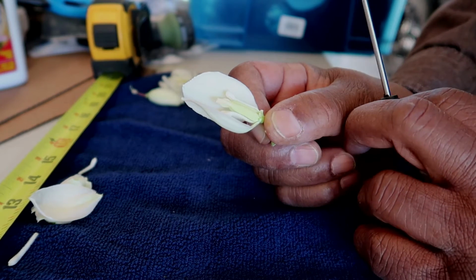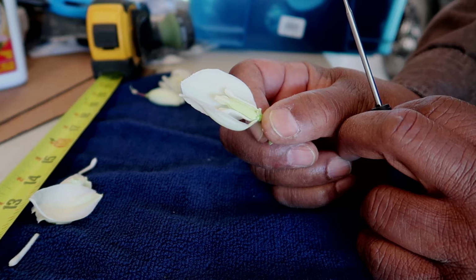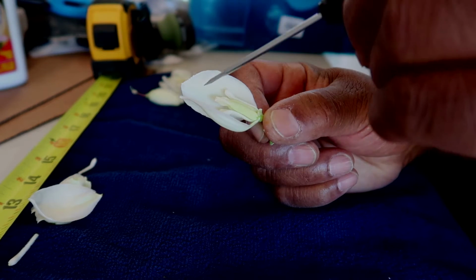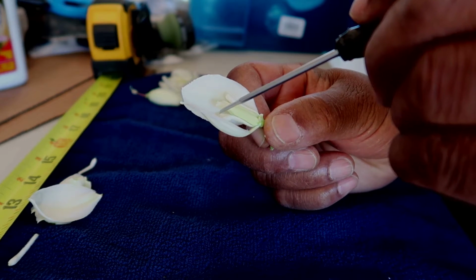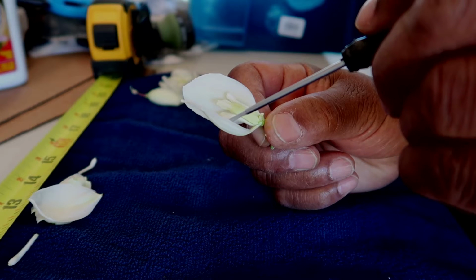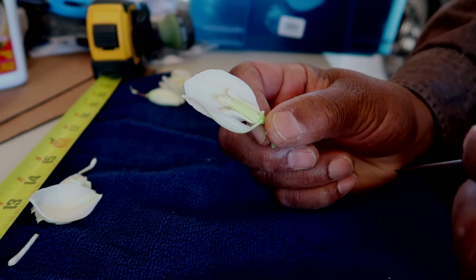So this is open at night, and the Yucca moth, the Tegeticula synthetica, enters the flower from the top and comes down to this section of the flower and starts gathering pollen from the anther.